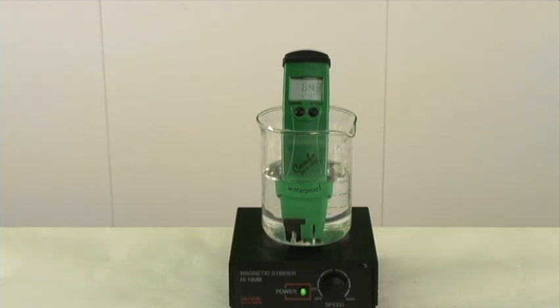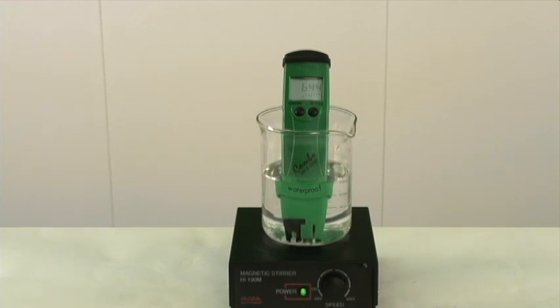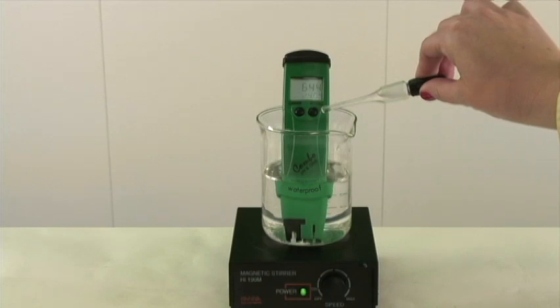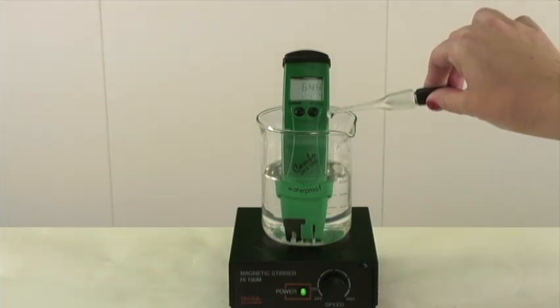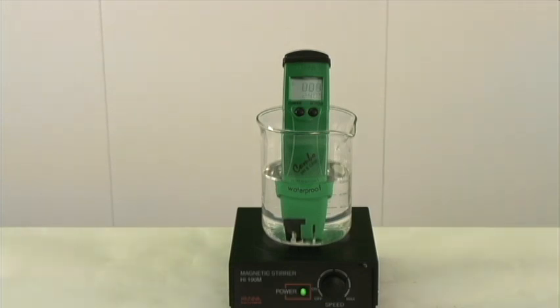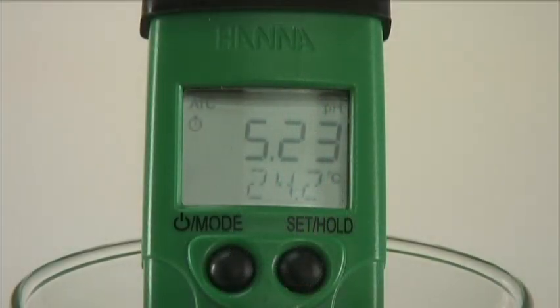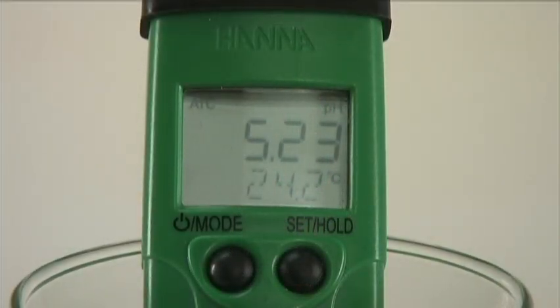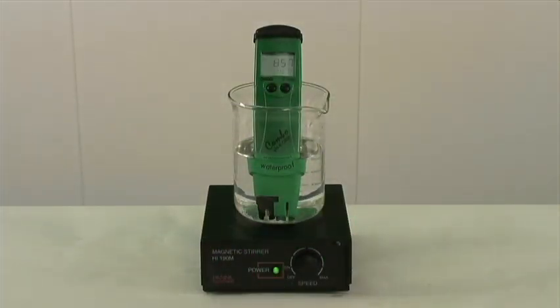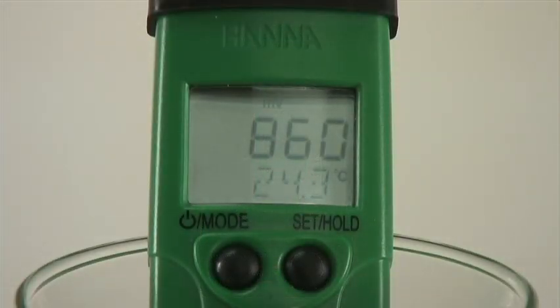I'm now going to add a small amount of acid to lower the pH and therefore increase the millivolt reading. We'll start by measuring pH. We got a pH of around 5.2. Let's now measure the ORP — I simply switched over to the millivolt option. Our ORP came out to be around 860.